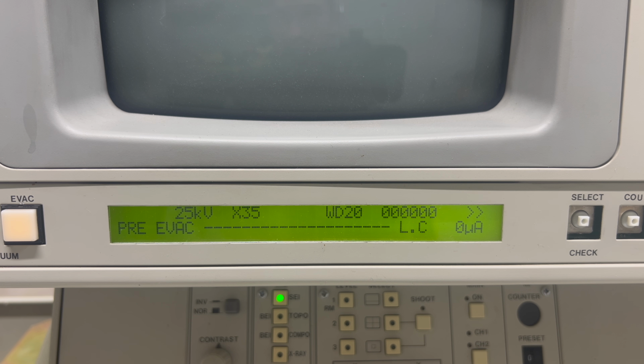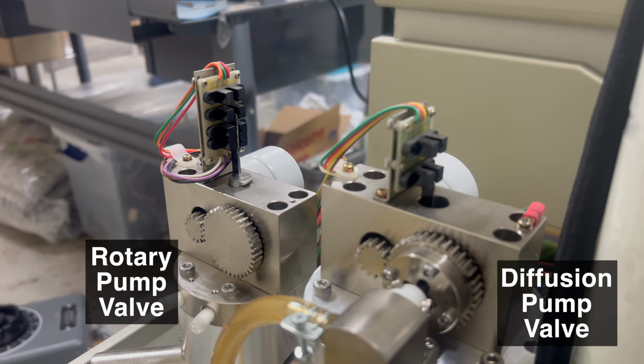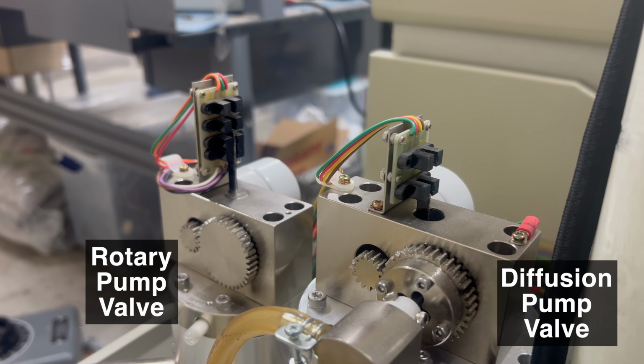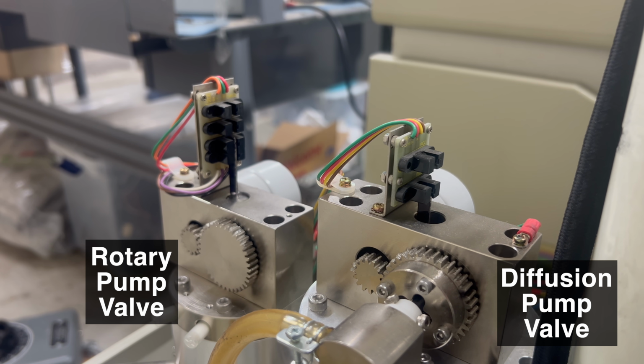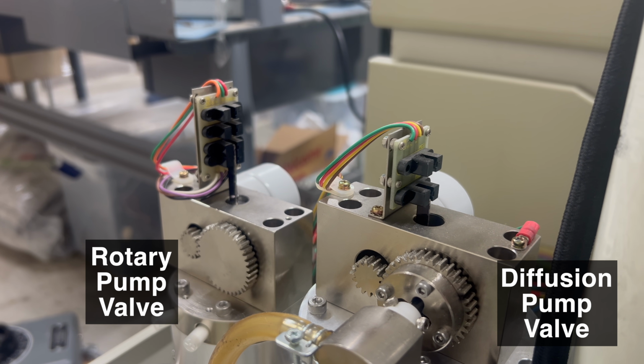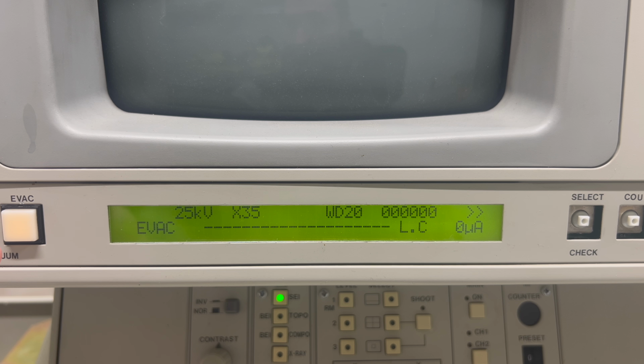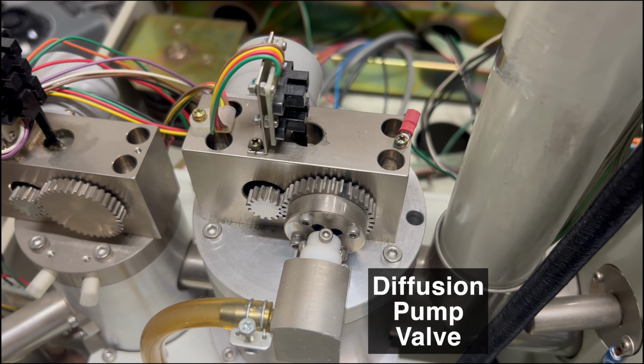This is where the SEM uses the rotary pump to evacuate the chamber before it switches to the diffusion pump around about 50 millitorr. Once it reaches that point, it will open the valve and use the diffusion pump to take it all the way down to a high vacuum, about 0.05 millitorr, around 1,000 times better than the rotary pump alone. I waited for the pressure to drop, and yes, the system correctly switched over right around the 50 millitorr mark as expected.